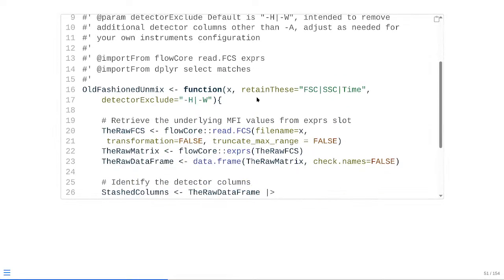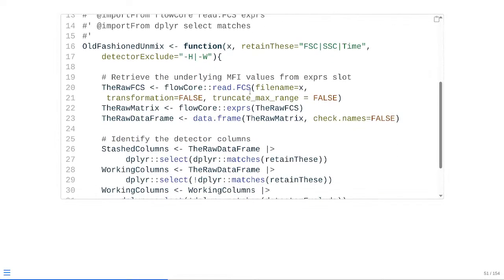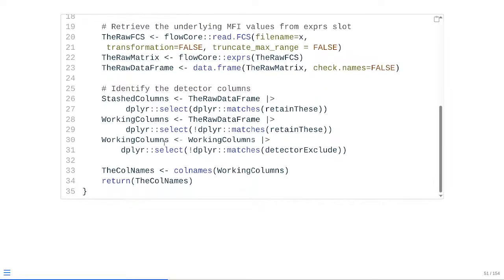Additionally, at this point, we just need to go ahead and update. So as we scroll downwards, we can see as we go down here, we're setting up a new working columns. And from the new working columns, we're just setting this one to exclude for detector exclude columns across the board. So at this point, in this case, we're not really isolating out anything separately. We already have the hyphen A selected for. So in reality, we're just keeping what we already have present and moving the rest out. And at that point, just refresh the function and just go ahead and proceed.